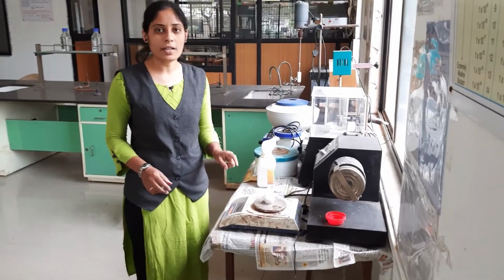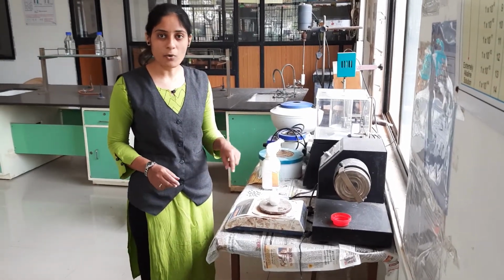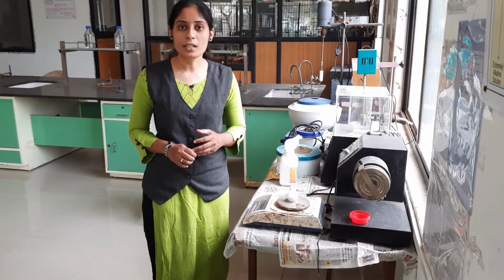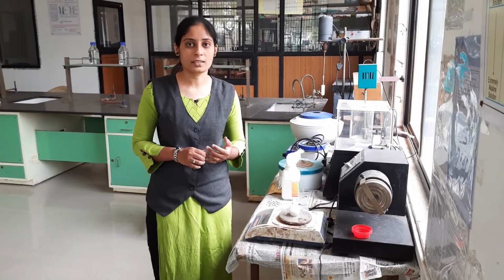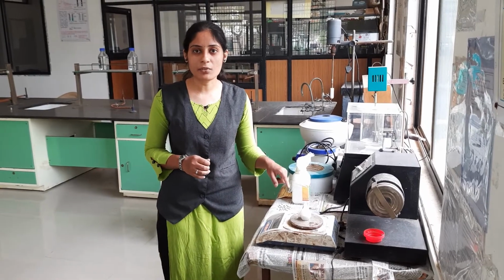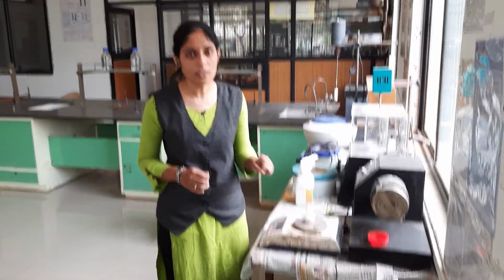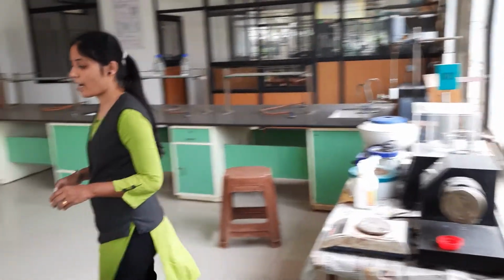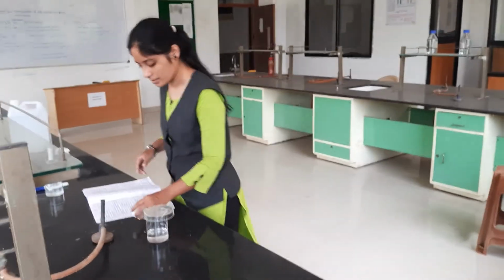This weight we call the specific gravity bottle weight with powder sample and with liquid sample. This is called the W5. In W5 we have to take the 3 weights: powder sample weight, benzene liquid weight and specific gravity bottle weight. We note down this weight, then we start the calculation part. For determination of true density we have to take the weights W1, W2, W3, W4 and W5.